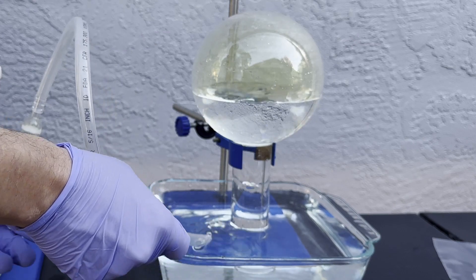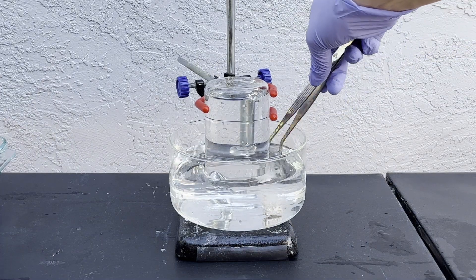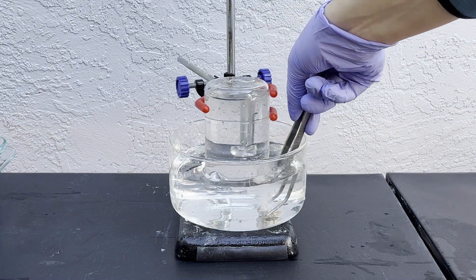Now that it's displaced the water in this flask, I'll prepare some acetylene by carefully placing some calcium carbide underneath this beaker full of water.